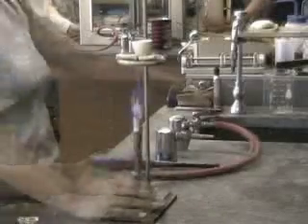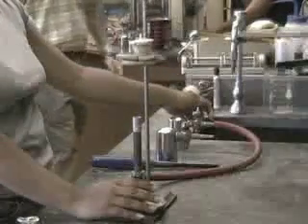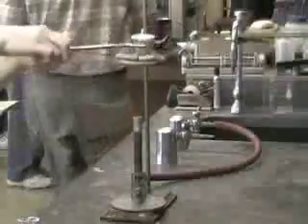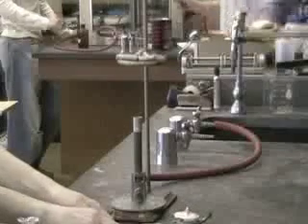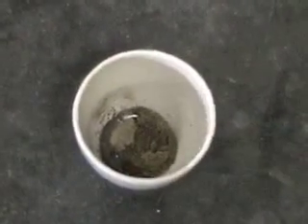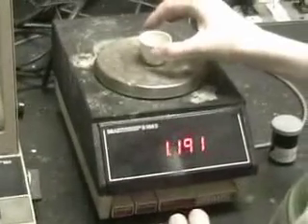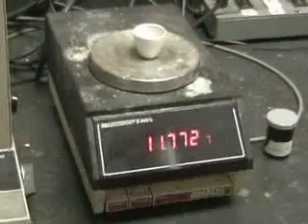First, we heat off all the water and dehydrate the sample. We first heat the sample with the cover off of the crucible. Then we let it cool with the cover on the crucible so water cannot re-enter the sample. We can tell the sample is dehydrated by the brown color. The mass of the water will be the difference between the original hydrated sample and the dehydrated sample.